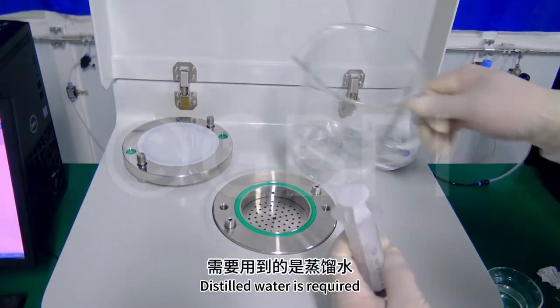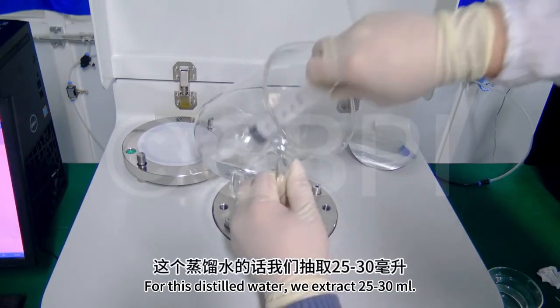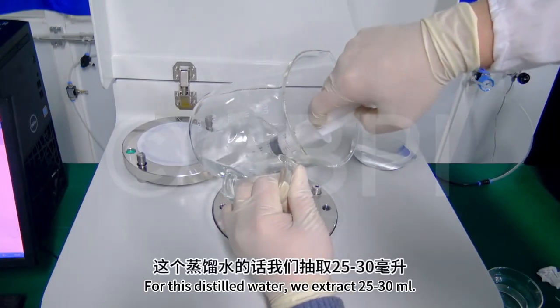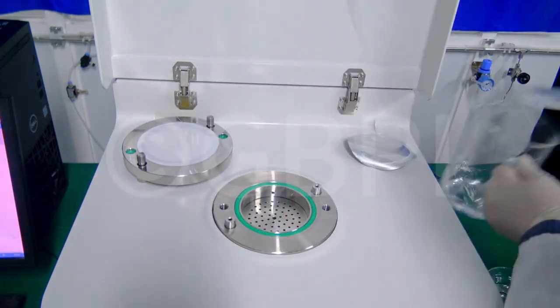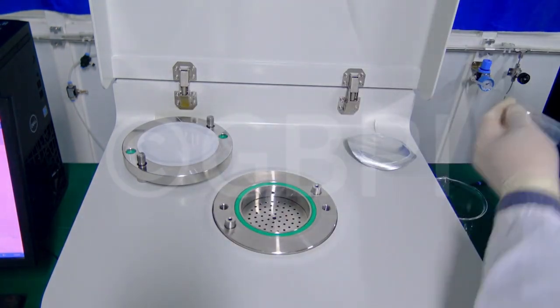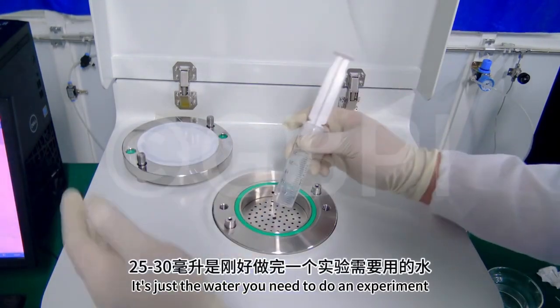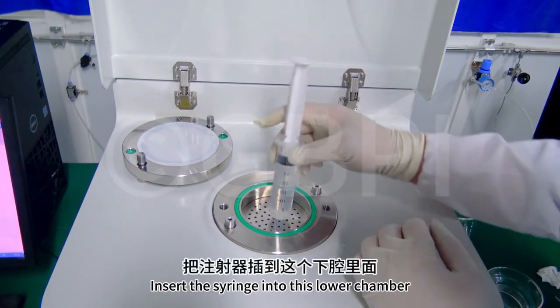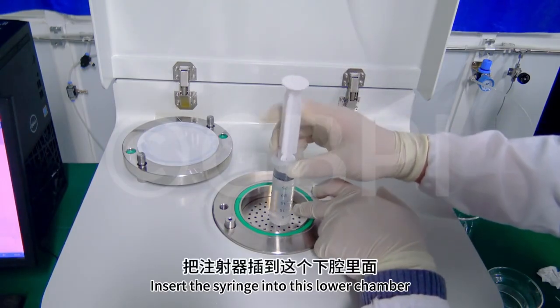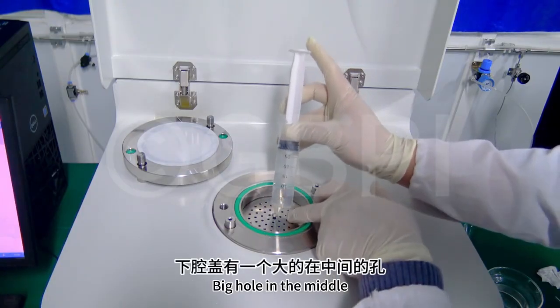Then take out our syringe in the accessory box. Distilled water is required. For this distilled water, we extract 25 to 30 milliliters. It's just the water you need to do an experiment. Insert the syringe into this lower chamber. There is one big hole in the middle of the lower cavity cover.